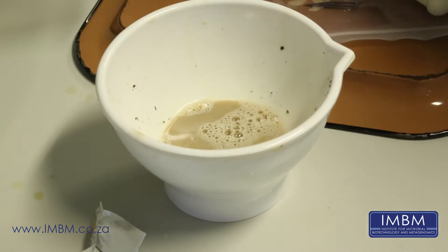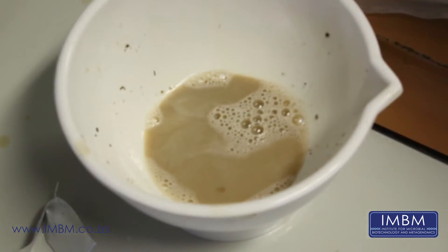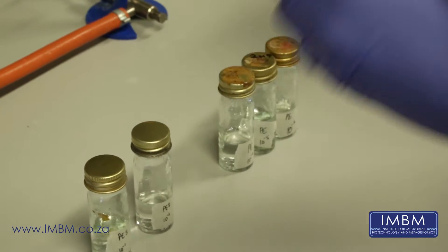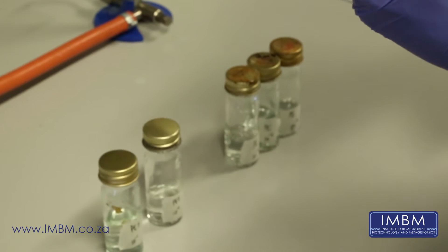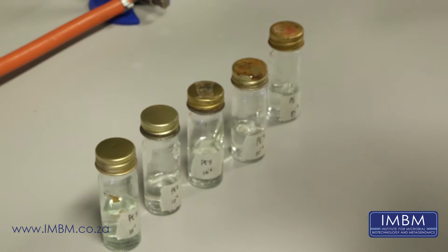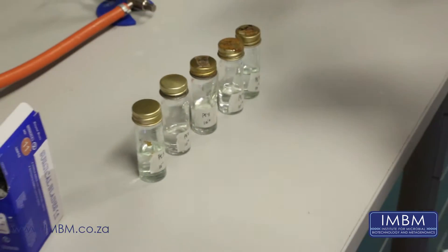What we're left with is the liquid portion of the macerated sponge. Each vial contains about 9 mils of sterile artificial seawater, which we intend to use to prepare our seawater dilutions. As you can tell from the labels, our concentrations are going to range from 10 to the power of minus 1 to 10 to the power of minus 6.